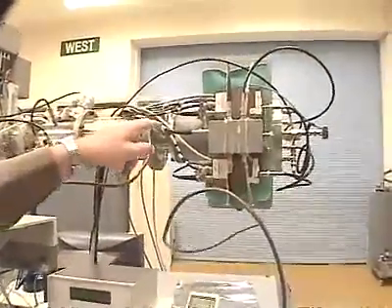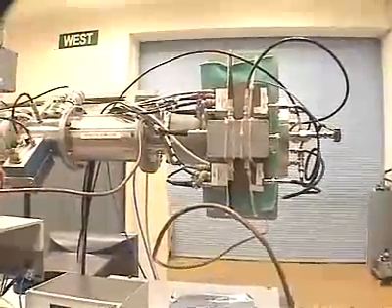Well, if you are a radiocarbon atom, this is the end of the line. The atoms come down into this grey cylinder, which is a detecting device, and that will generate an electric pulse for every atom that comes in. The pulse goes to the computer in the control room, and we calculate from the pulses that come in, and then we know the age of the sample that we've been dating.